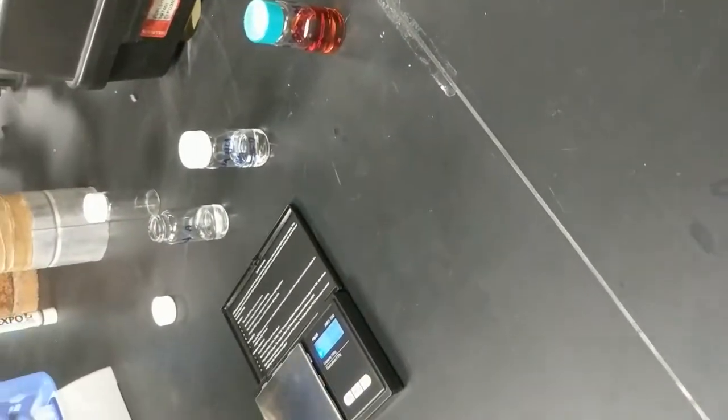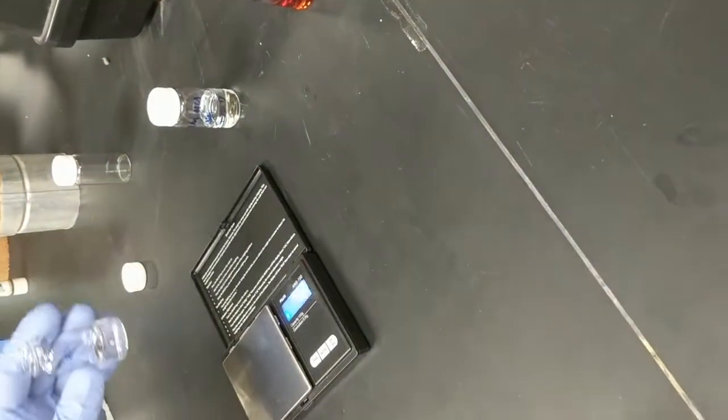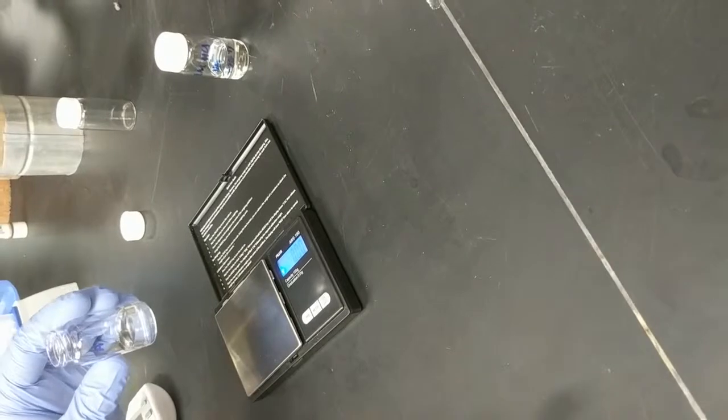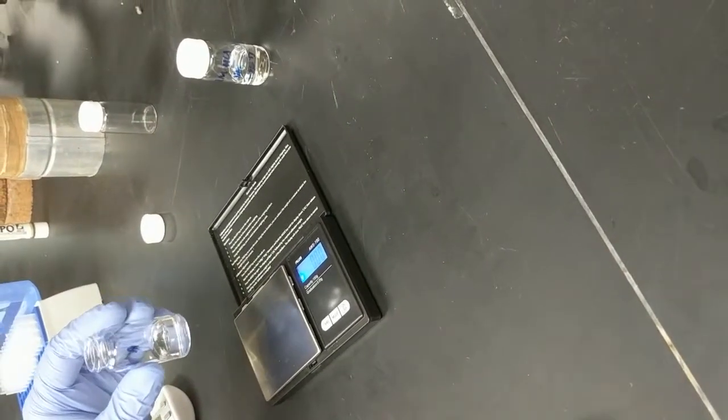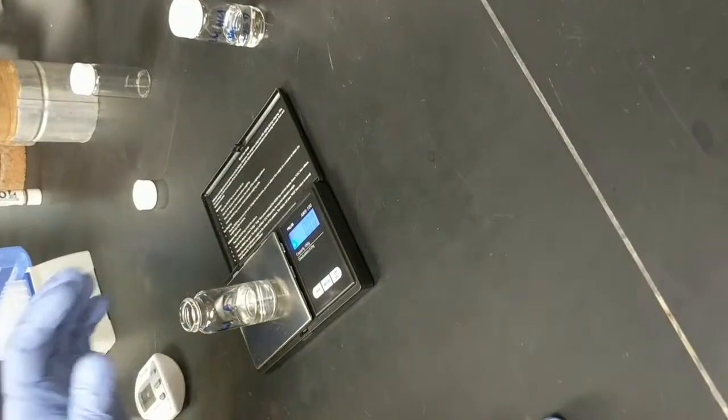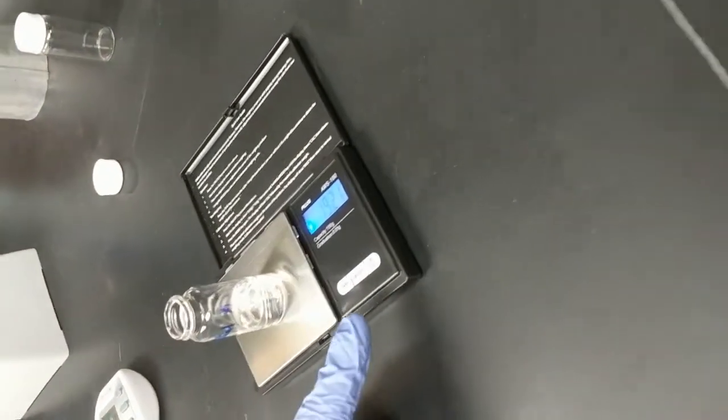Alright, the 15 minutes is complete, so the next step is to add acid to our reaction vial. This can be done in a number of ways. We can pipette 2 mils of the 1.2 molar hydrochloric acid, or we can do it by mass. Here I have a portable scale that's operated by batteries. It's a centigram scale from AWS.